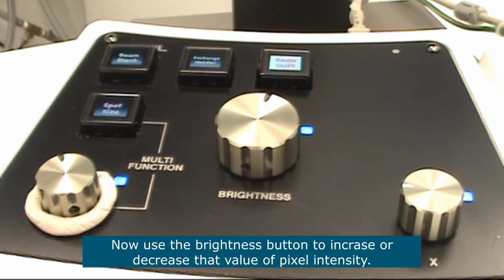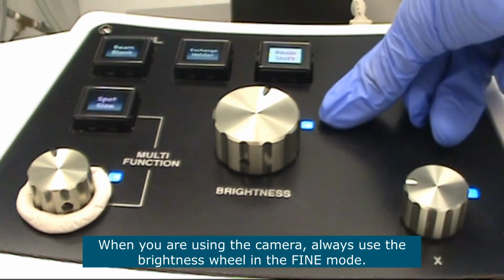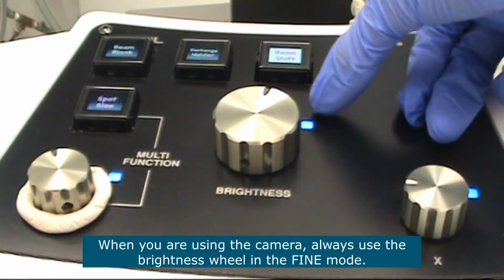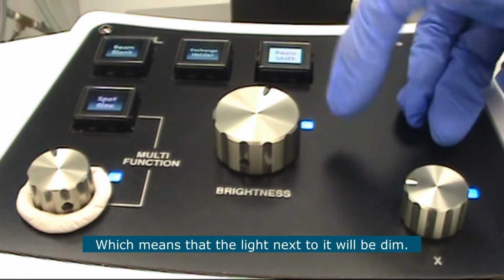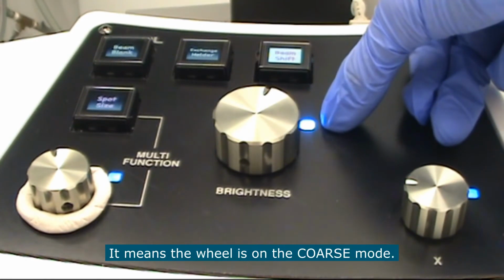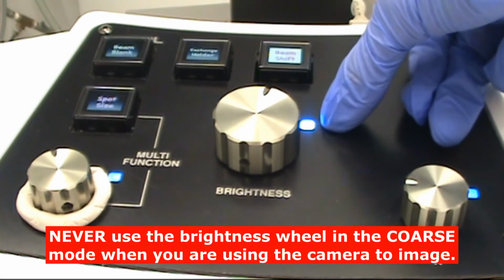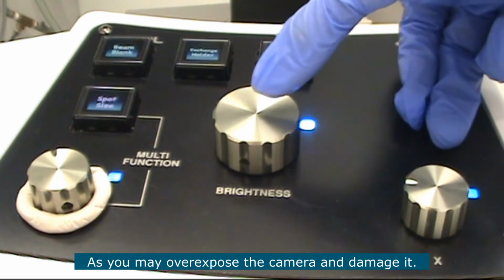Now we're going to use the brightness button to increase or decrease that value of pixel intensity. When you are using the camera, always use the brightness button in the fine mode, which means the light next to it will be dim. If the light next to the brightness button is very bright, it means it's in the coarse mode. Never use the brightness button in the coarse mode when you are using the camera, as you may accidentally overexpose the camera and damage it.